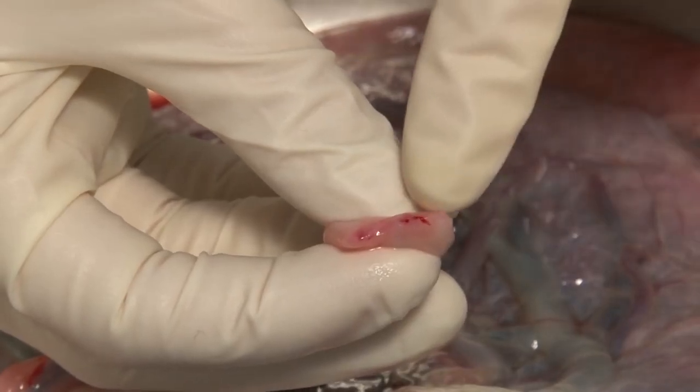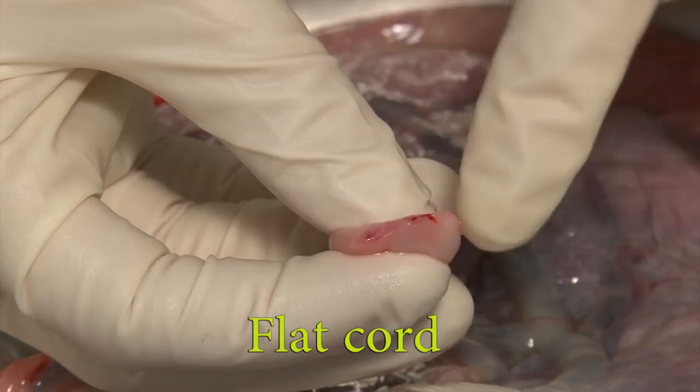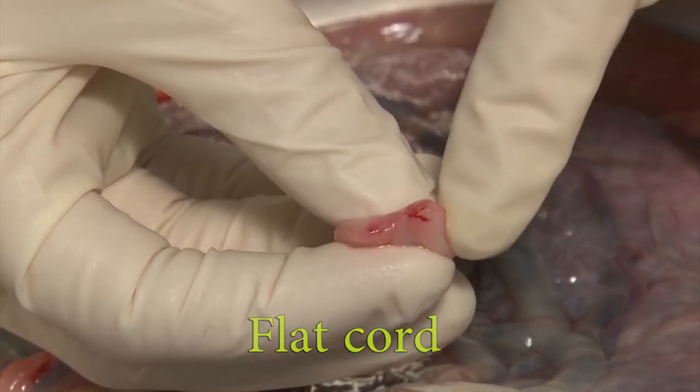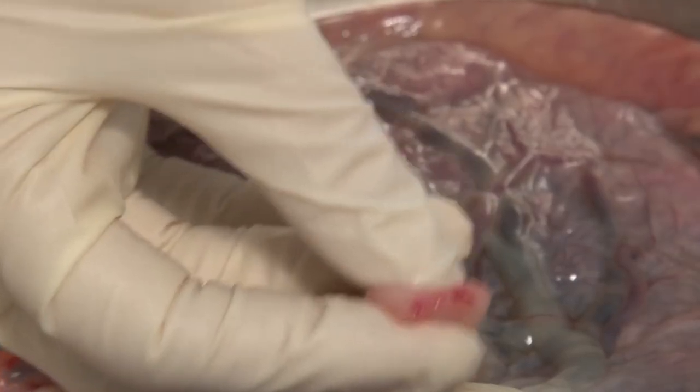Here is a cord with a reduced amount of Wharton's jelly, known as a flat cord. If the diameter would be less than 7 millimeters, it would be defined as a thin cord which has a compromised blood supply.